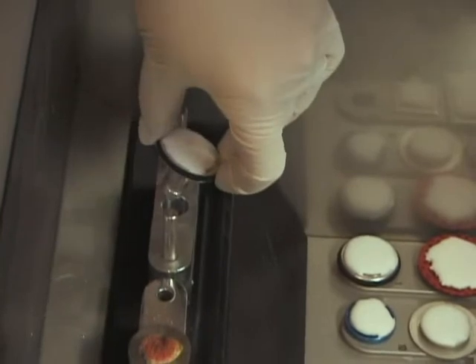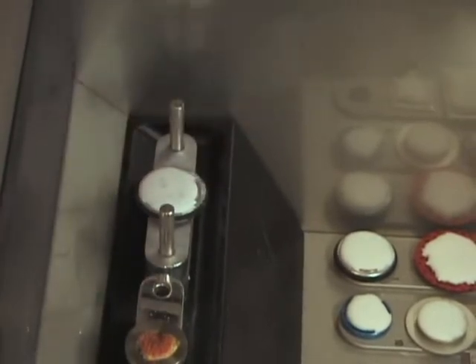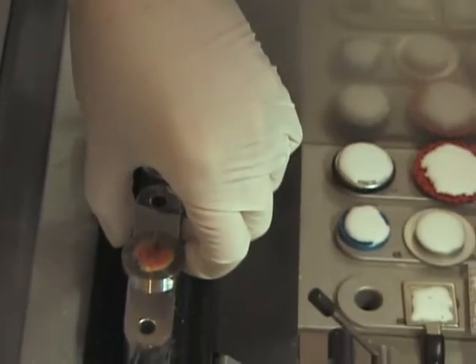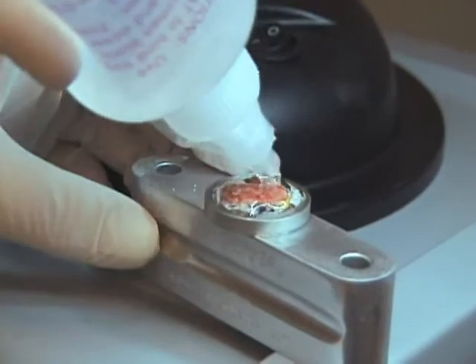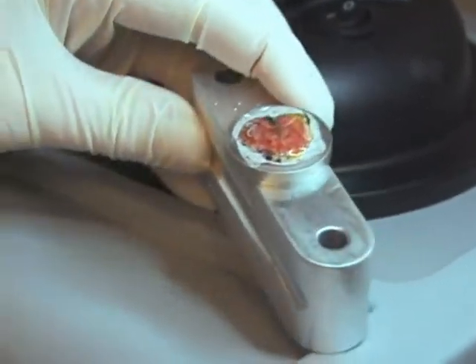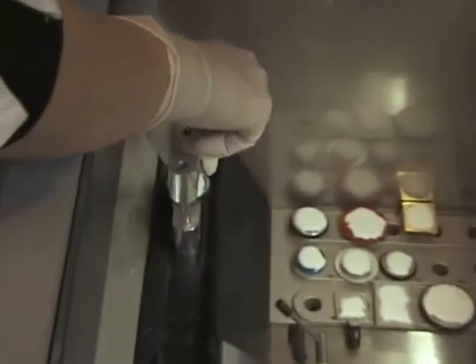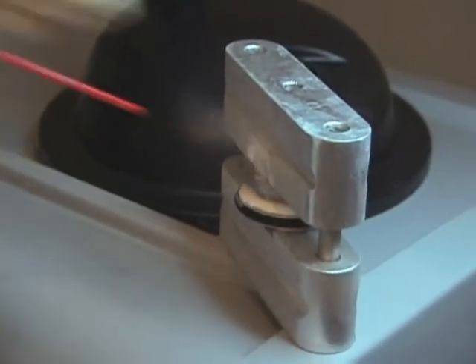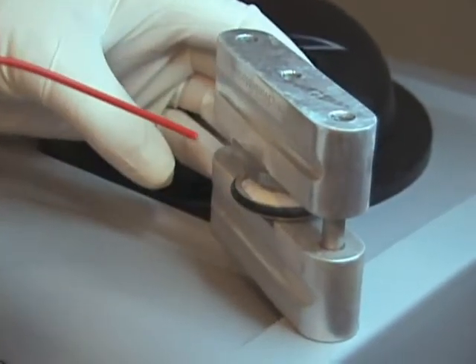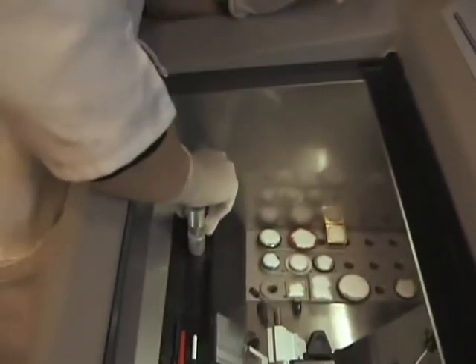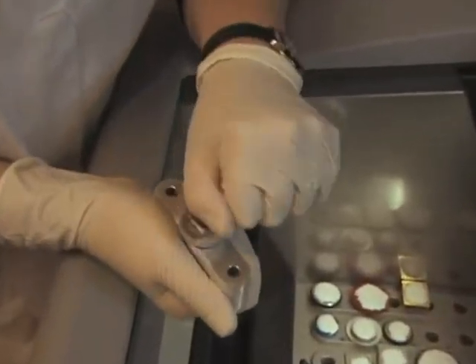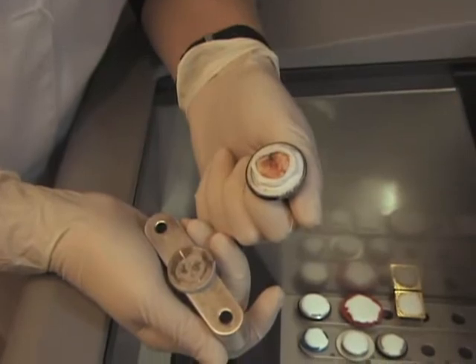The following will demonstrate the embedding process with a variety of cryostat chucks. The Microm chuck fits into the center hole of the bottom section of the embedding device, and the flat disc with the frozen specimen fits into the center hole on the top section. The specimen is covered with embedding medium. You can see here how the medium has already begun to freeze. It is immediately turned over onto the cutting chuck, keeping the specimen securely in place. Then lift it outside the chamber to apply freeze spray while rotating the disc. It's important to keep the unit inside the cold chamber as much as possible. The top portion is lifted off with the discs. When the discs are separated, the tissue has been transferred to the cutting chuck. Perfect.